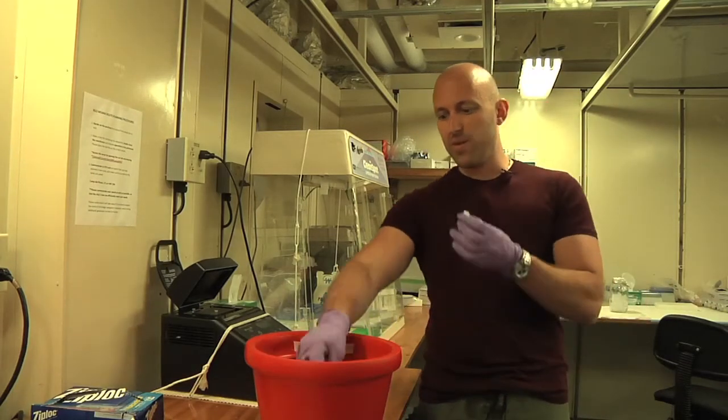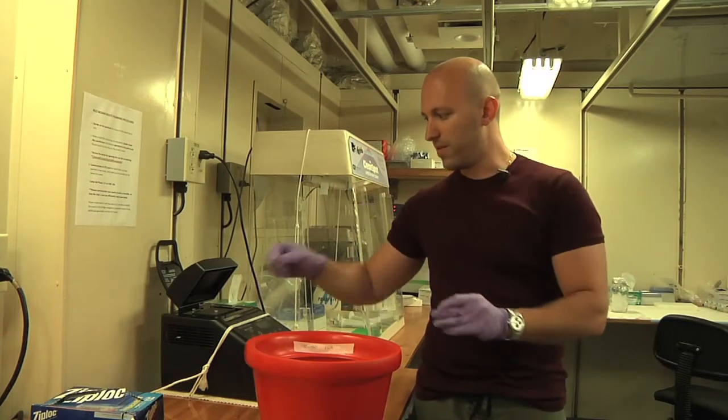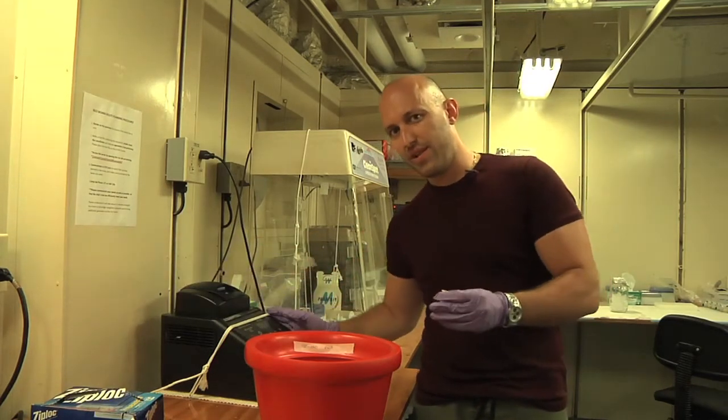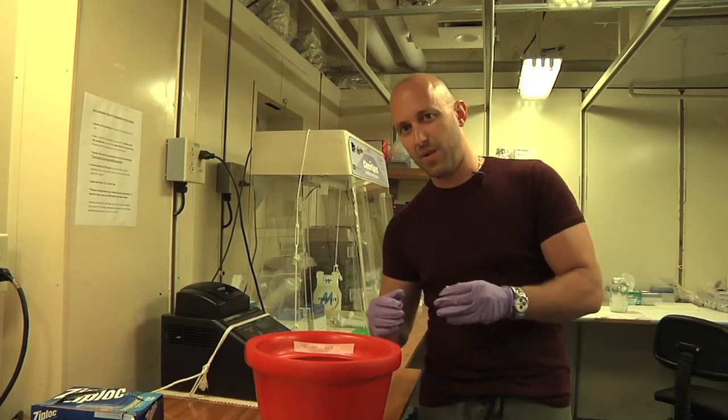So for doing that, we will use PCR, which is putting a little bit of DNA in the small tubes, putting them into this machine and incubate for about 3 hours, and then we will get millions and millions of copies of the DNA that we want.